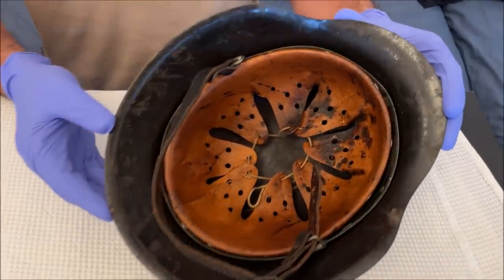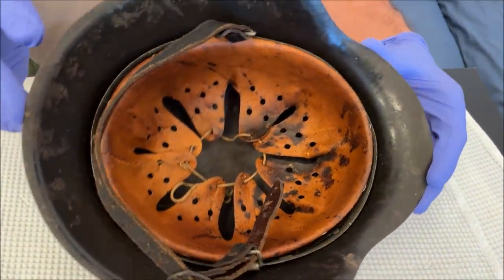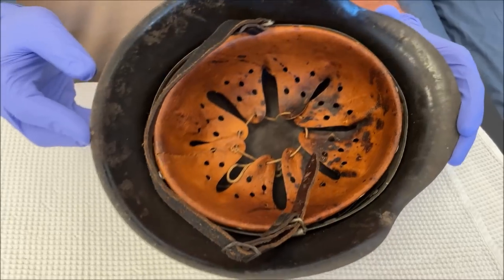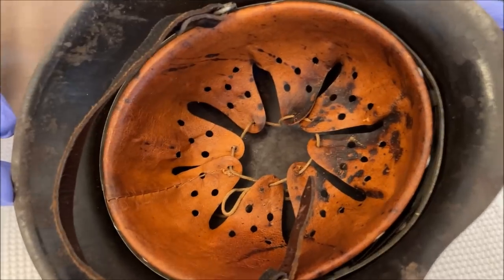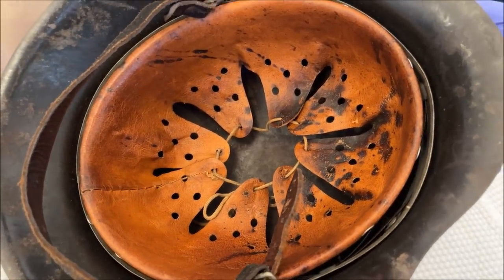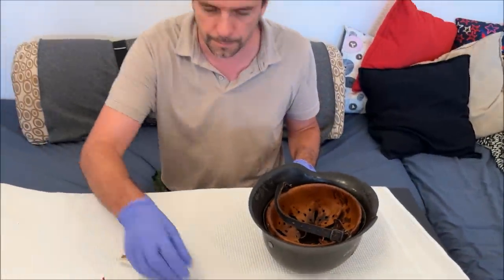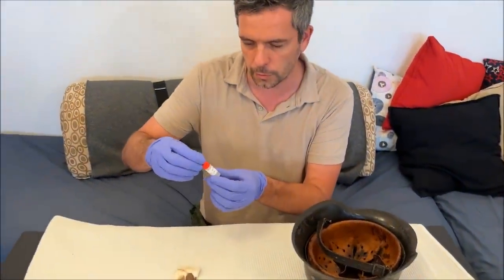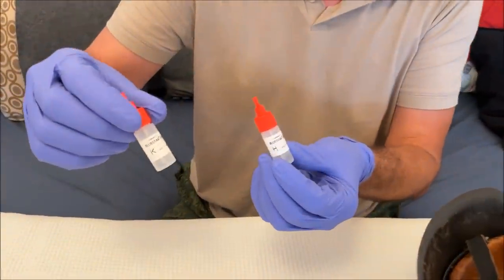I find that these stains are kind of convincing — they really do look like a fluid splashed around inside the helmet — but they're also very black. Is this blood, or is it oil, or something else that fell on the helmet? So now we're going to try to find a scientific response to the question.